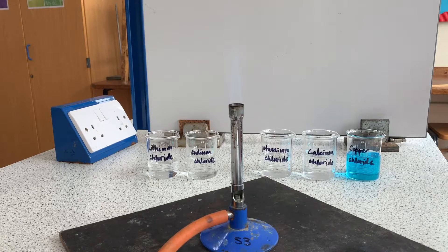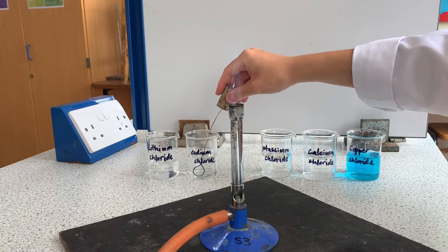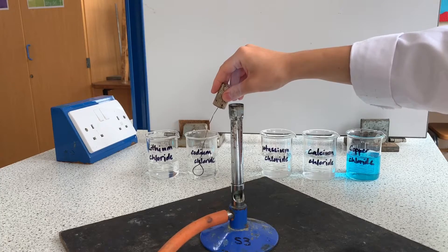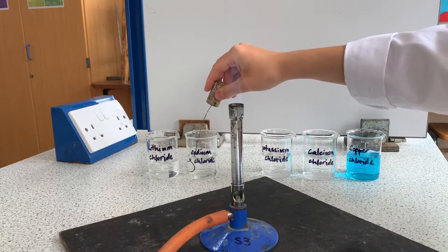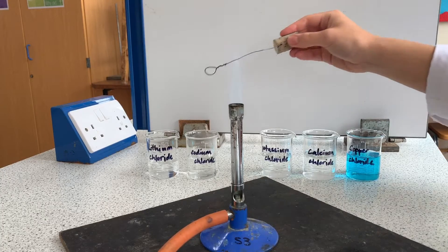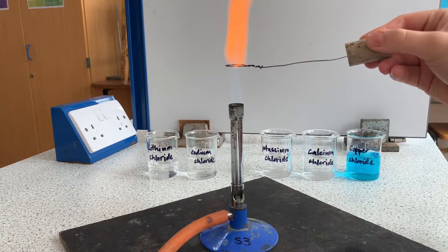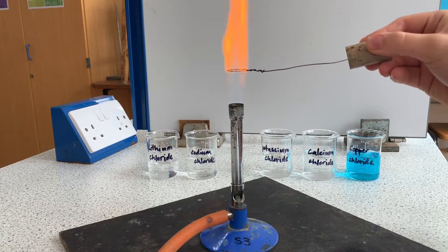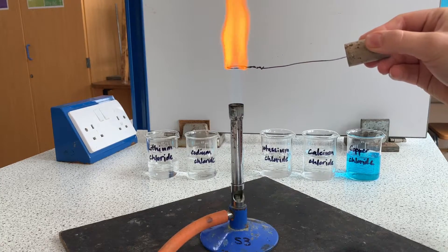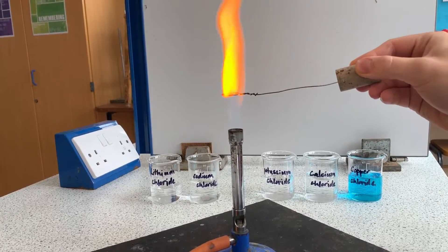Next the sodium solution. This time we've got quite a strong yellow color coming through.